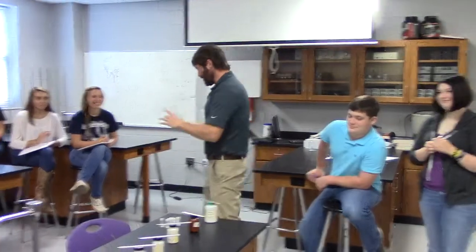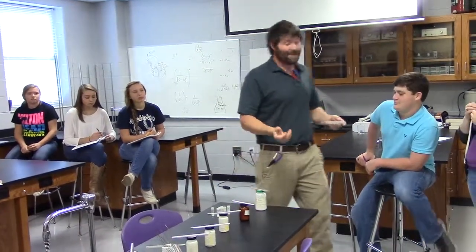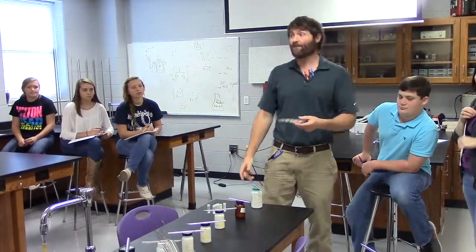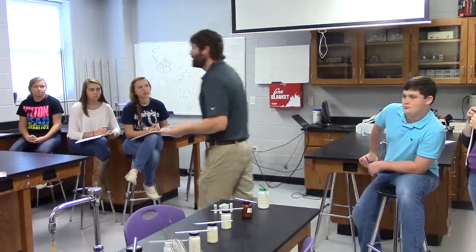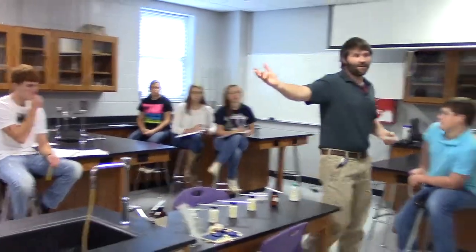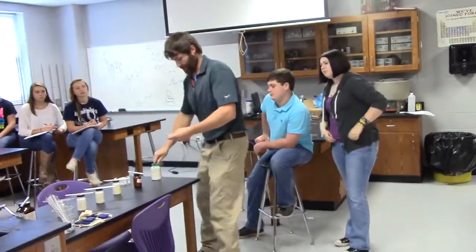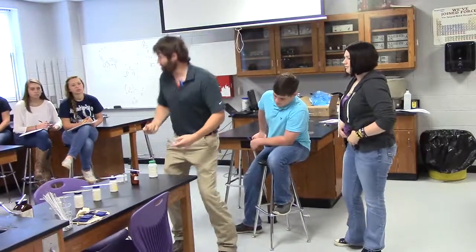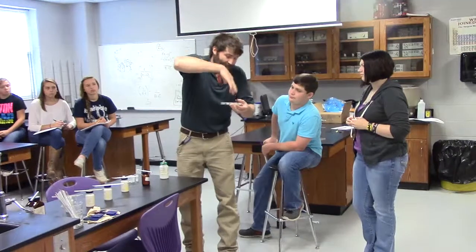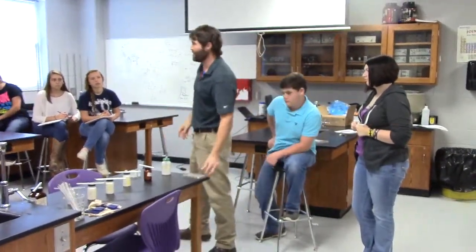But anyway, what should you do though if you get too much? Inevitably, one of you is going to take a scoop and go whop, and you're going to get way too much of something than you ever needed. In other words, you do a lab that says get 2 grams of NaCl, and you grab 5 grams. What do you do with the extra 3 grams? Oh, Mr. Cole's going to be mad. Start putting it back in there? No. Do not ever take something from what you've got out and put back into the container again.